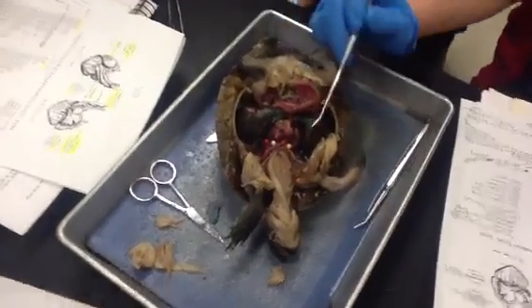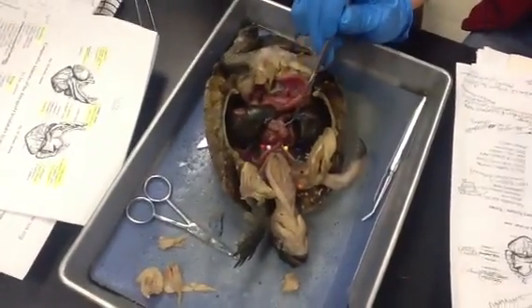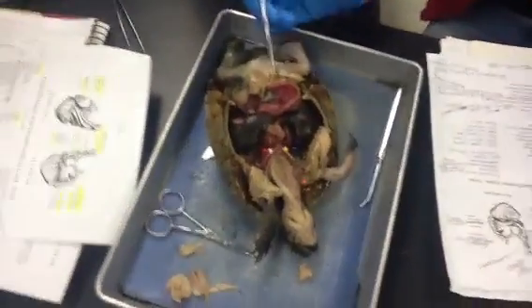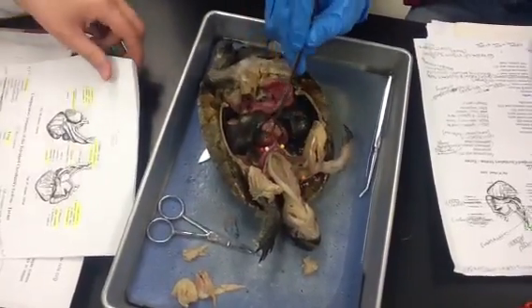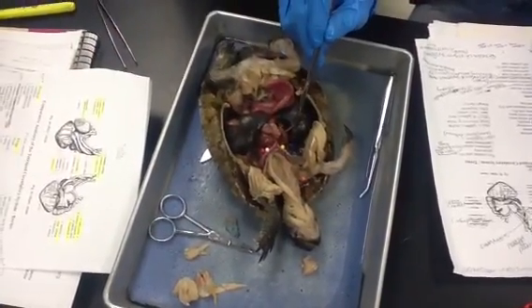So the ventricle — the heart's right here — these three portions, and the middle part is the ventricle, and then the left atria and the right atria.